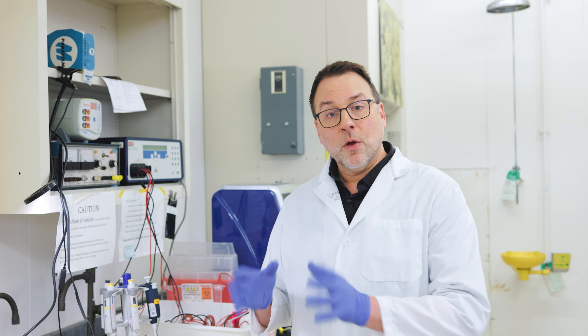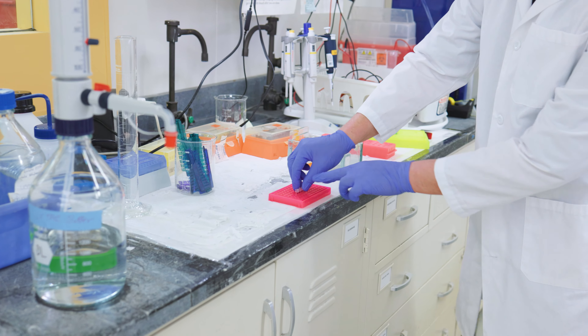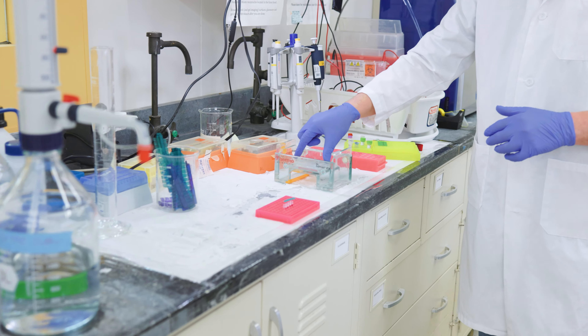I've done a PCR, or polymerase chain reaction, which is amplifying that one gene that I'm looking at. That's done here.